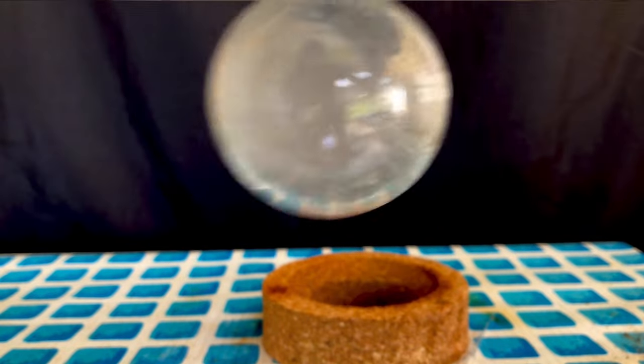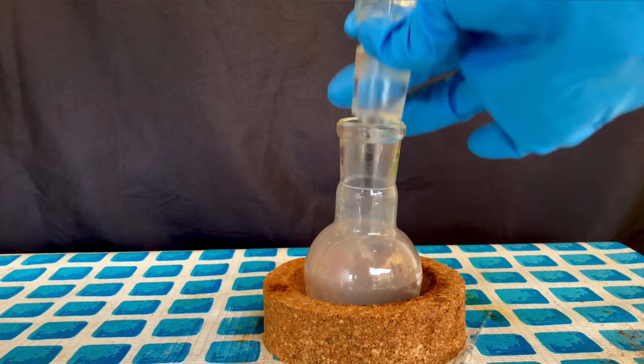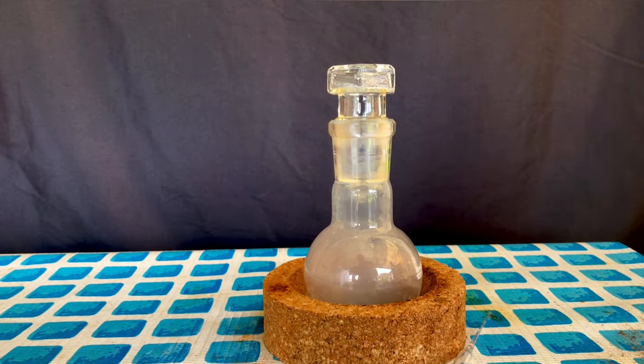As it turns out, phosphorus tribromide and water won't mix very well, and if you don't shake them, they won't react violently, but the phosphorus tribromide is just going to sit at the bottom.